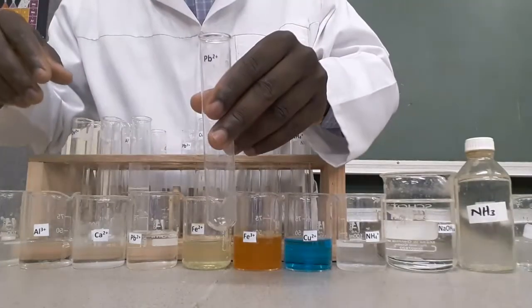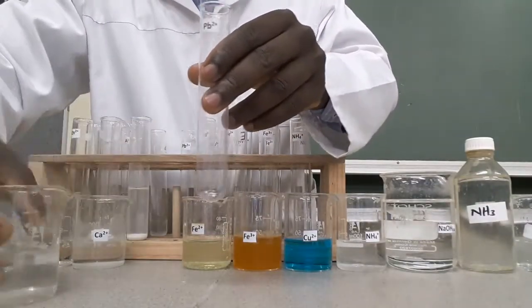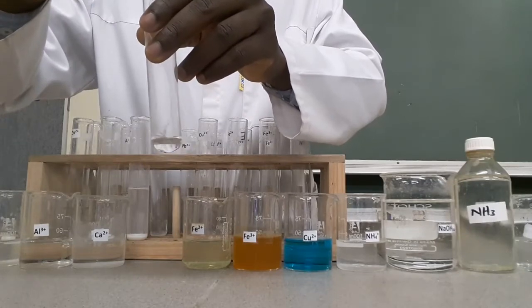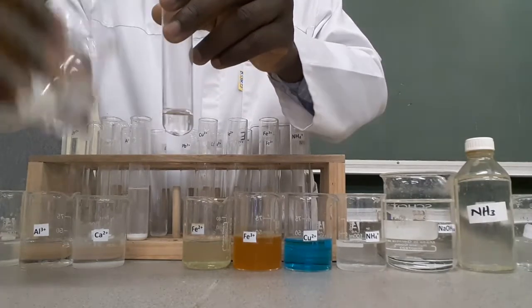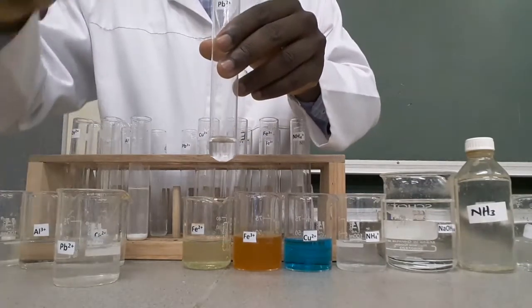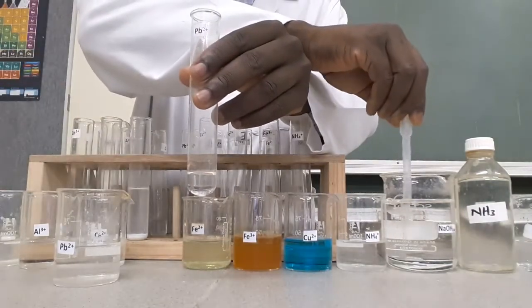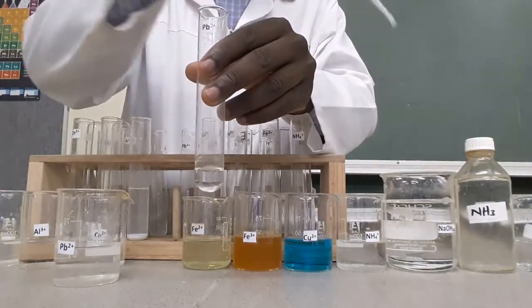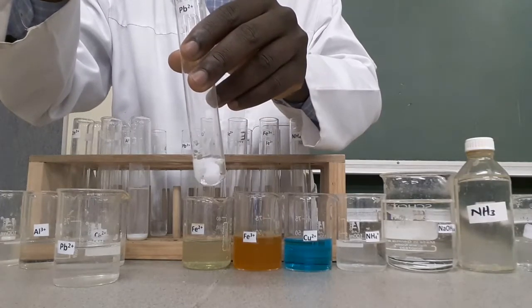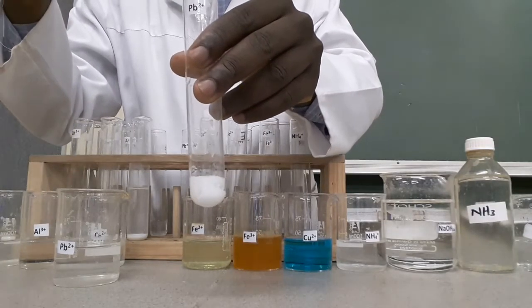Lead ions. Take a small portion of solution containing lead ions, about 1 to 2 cubic centimetres depth. Then add a few drops of sodium hydroxide to the solution containing lead ions. You can see there is a white precipitate forming.